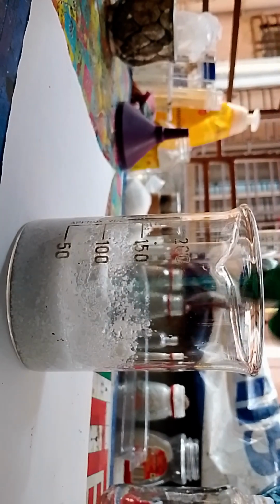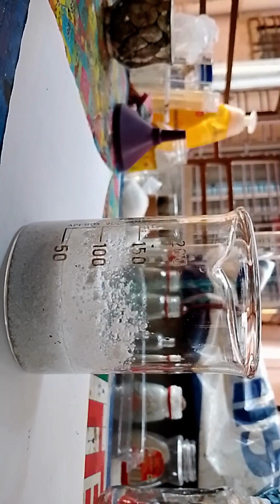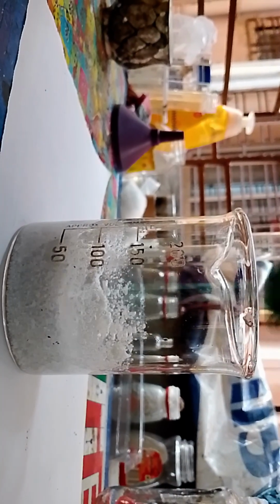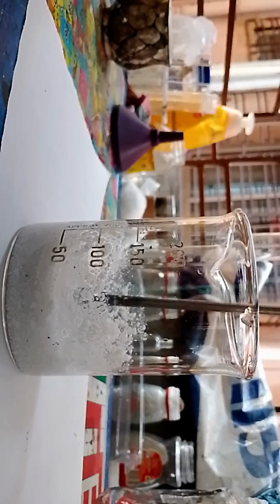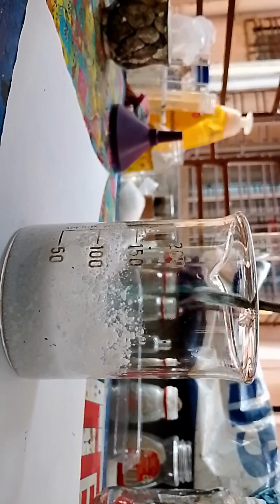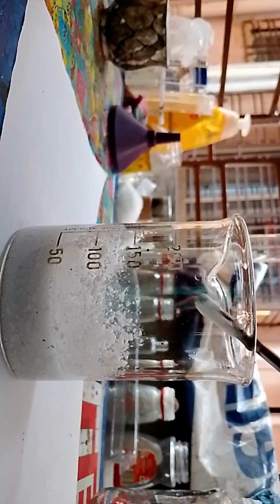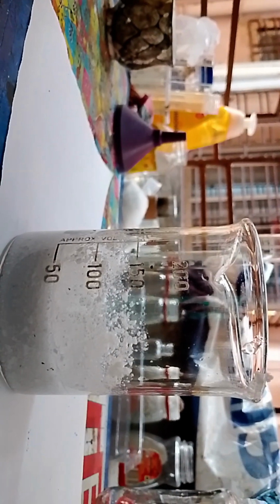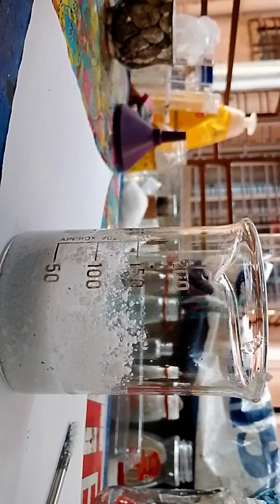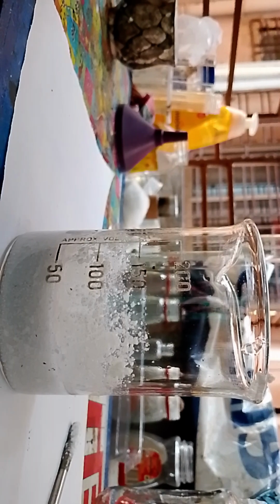It's becoming thick. It smells quite normal, but yeah, you can see it has thickened up. We are going to add a little bit more, which I don't think will be a problem. And do remember I use a paper sheet here because I don't want my table to be corroded away.